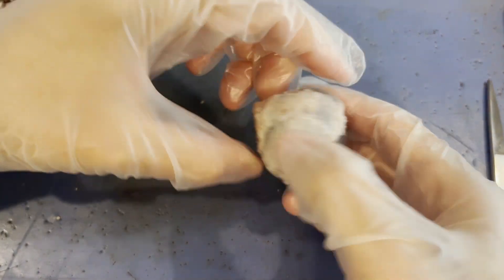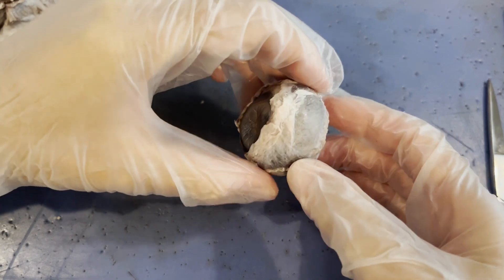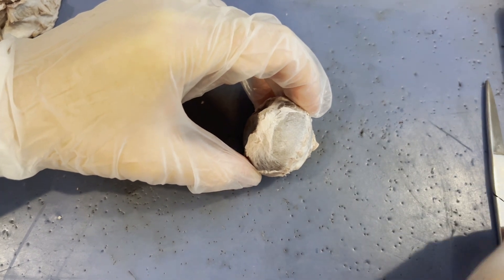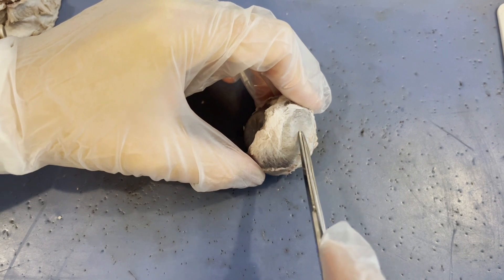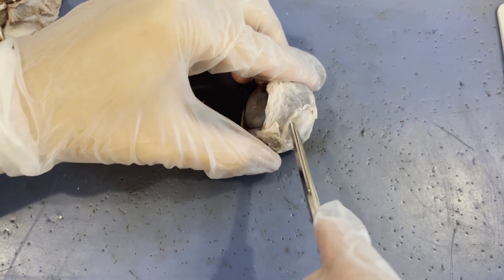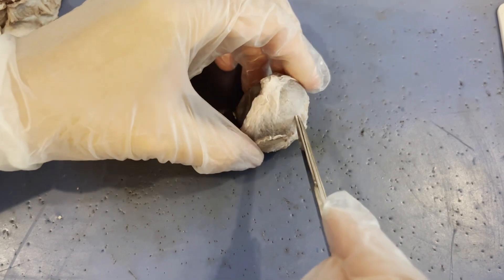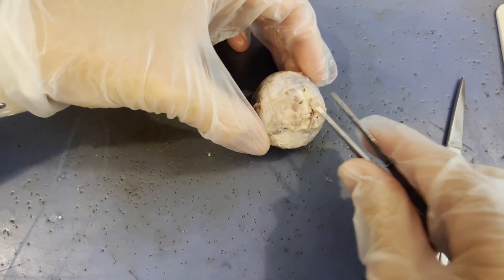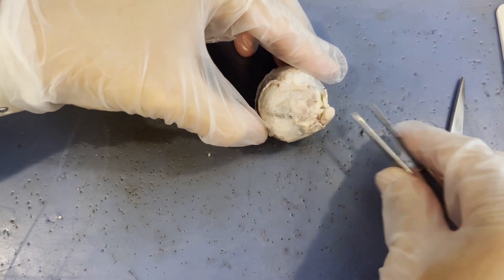If you are going to dissect along with this video, two things I'd recommend when removing the adipose tissue and muscle off of the sclera: number one, if you see any fluid leaking, it means you've gone too deep — you don't want to cut into the sclera itself. It's a pretty hard membrane with a totally different consistency than adipose tissue or muscle. Number two, you don't want to remove the optic nerve. If it happens it's not a huge deal, but it is nice to keep that structure intact.